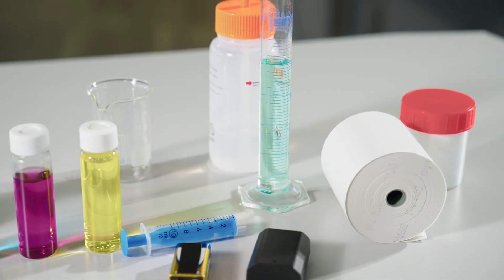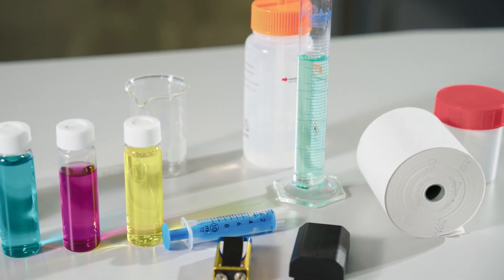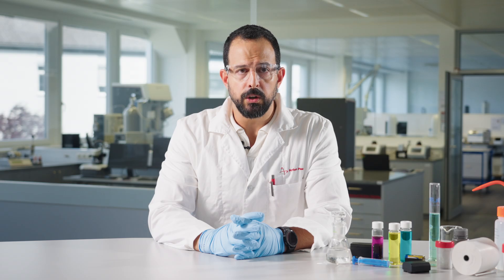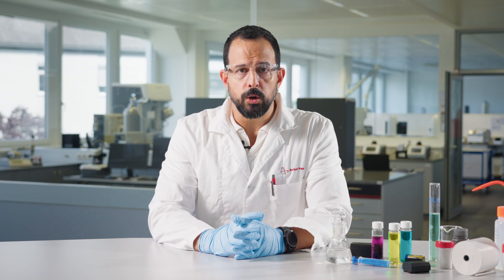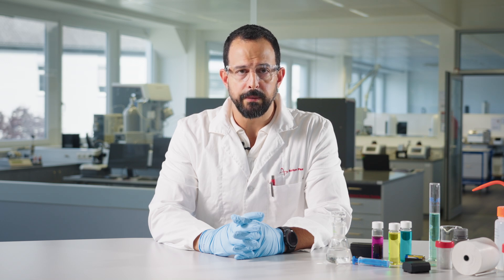Electrolytes are an integral part of a battery. They transfer ions between electrodes, causing the battery to charge and discharge. Besides the chemical composition of the electrolytes, physical parameters such as density, viscosity, and flammability or flashpoint are important to accurately measure, as they will directly affect the quality, performance, and safety of the battery.